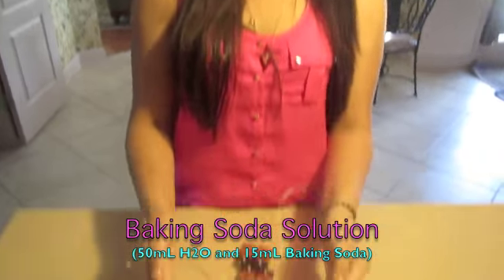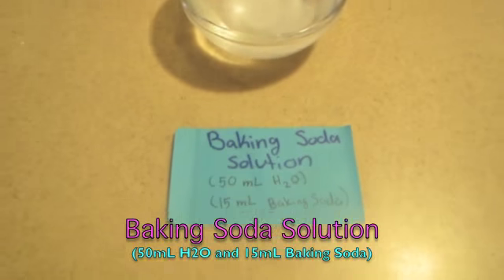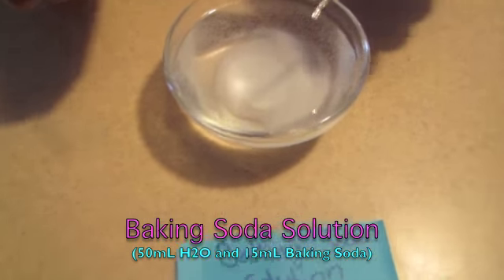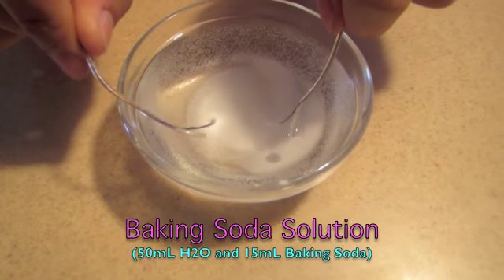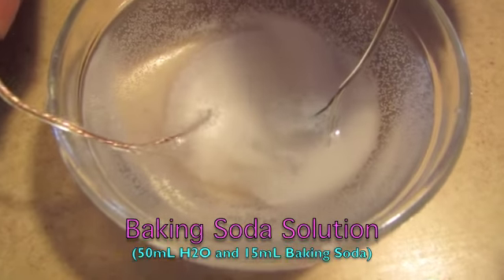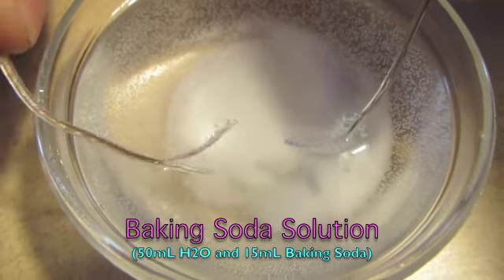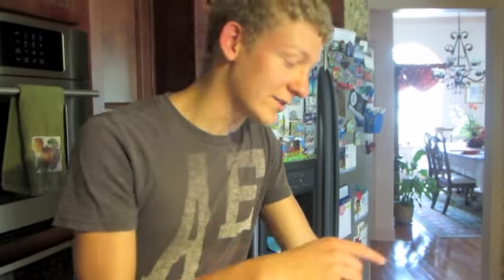And this solution is our baking soda solution, which contains 50 milliliters of H2O and 15 milliliters of baking soda. When I put the wires in the solution, as you can see, there's lots and lots of bubbles forming. Therefore, this is an ionic bond. This solution made a bunch of bubbles. This one is ionic.